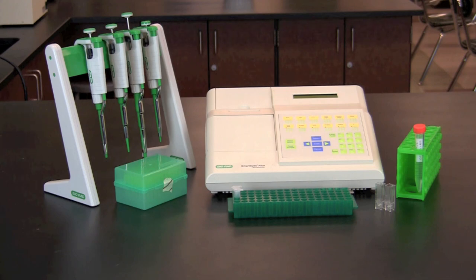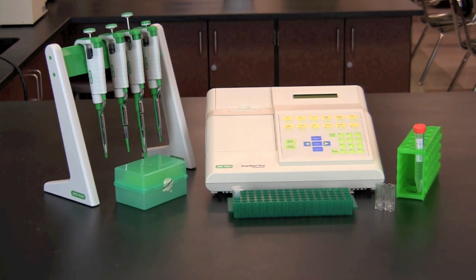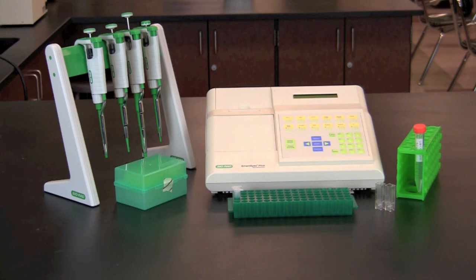In this video, you will learn how to perform DNA quantitation. There are many ways to quantify DNA. In this activity, the amount of DNA in the purified plasmid preparation will be estimated using a spectrophotometer.